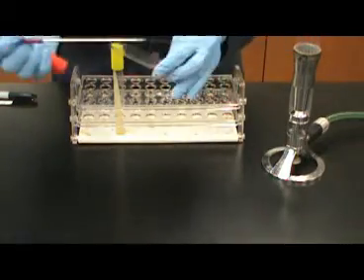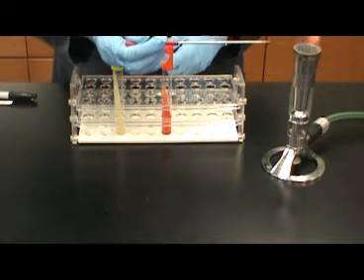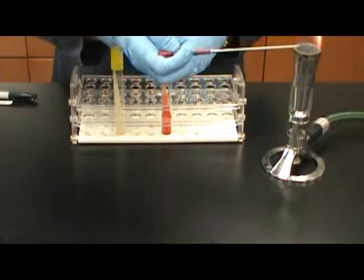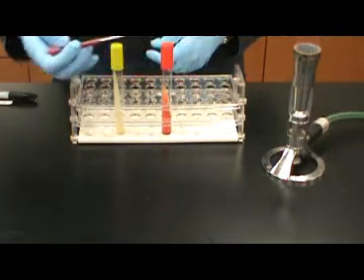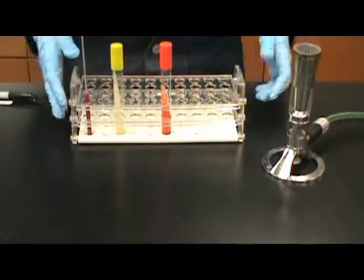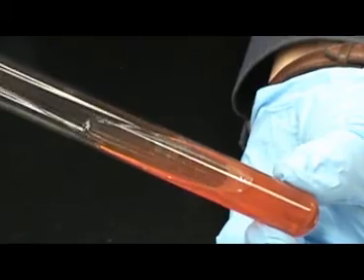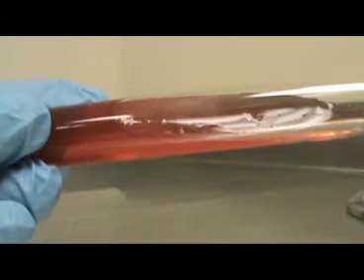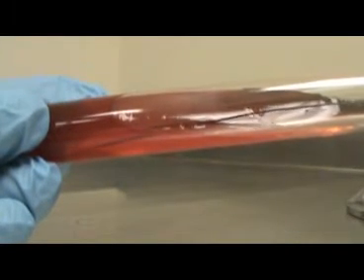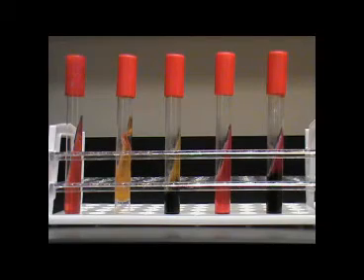Hydrogen sulfide production will be observed by the presence of a black precipitate in the bottom of the tube. When inoculating the TSI, you use a stab streak method. In this method, the thick bottom part of the tube, called the butt, will actually be punctured with the needle. The needle, when removing it from the butt of the tube, will then be run slightly across the slant. Using a needle will help avoid over-inoculation. Notice here that the needle actually punctures the agar, then comes up the slant afterwards. This technique introduces anaerobic and aerobic conditions as well as prevents over-inoculation.